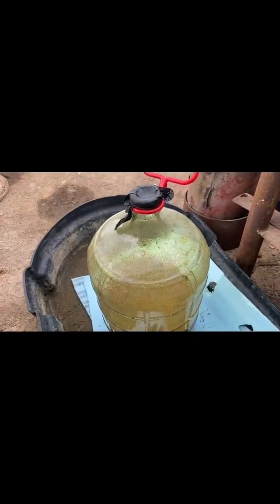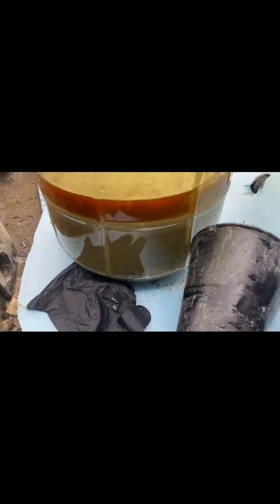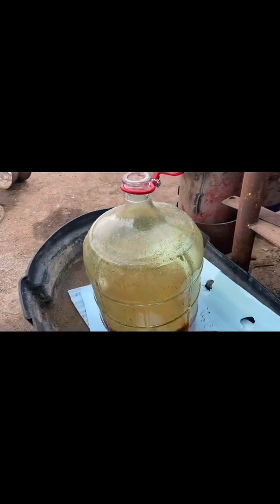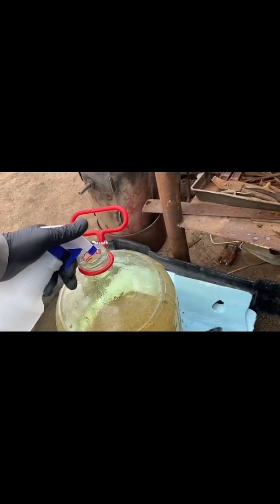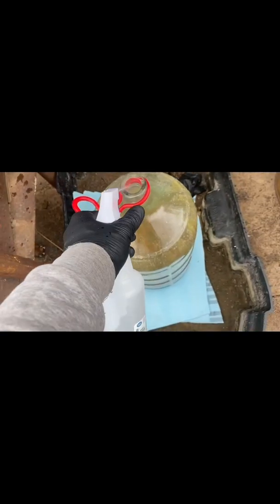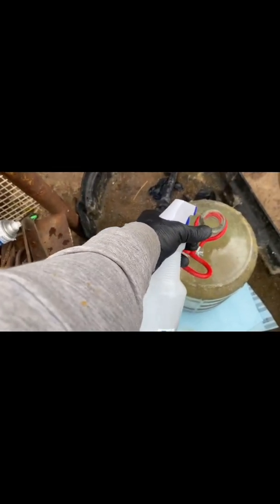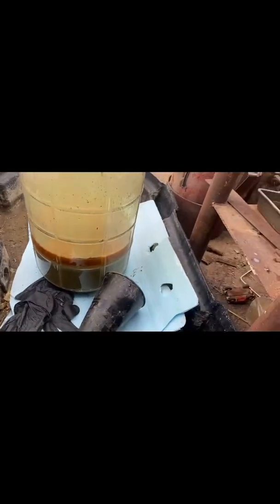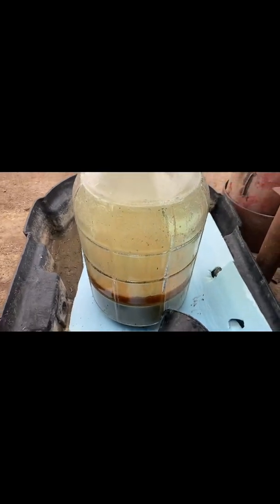I just mixed this up really good, shook it up. Look how nice that solution looks — it's going good. I just want to spray off the sides real quick, so the stuff that was stuck on the sides will drop back down into the solution. I got a new one going for this — but I hope you guys enjoyed it.